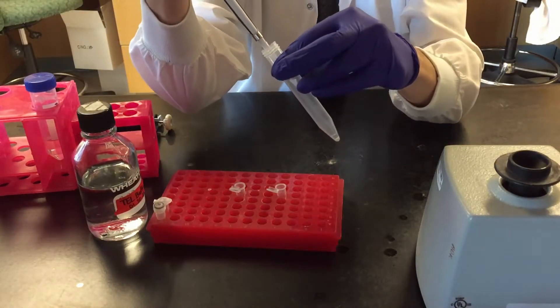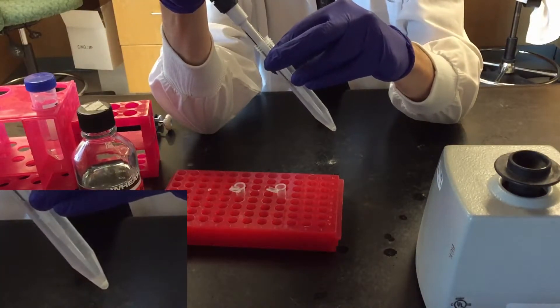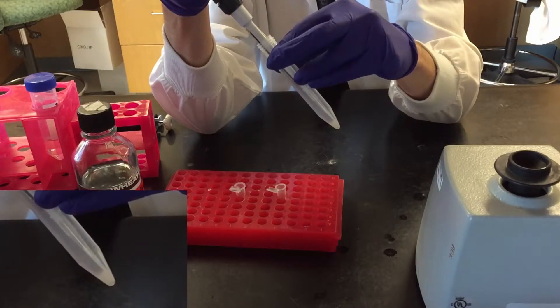Re-suspend cells in Tel Buffer and split into each tube, roughly 100 microliters each.